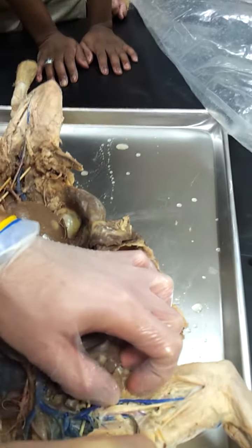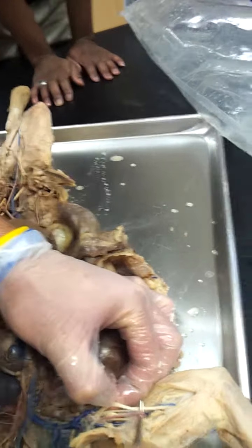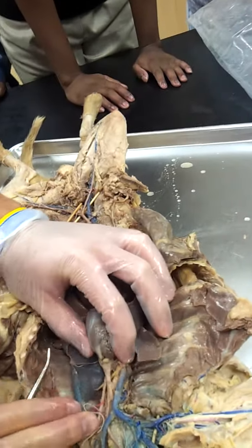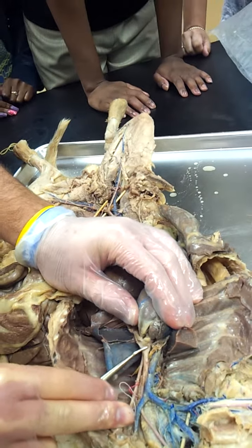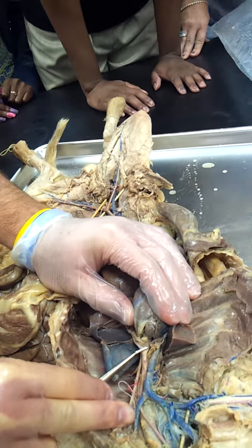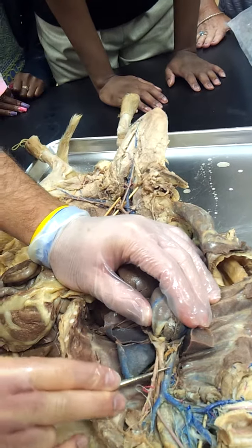Okay. We've got a lot of nerves here from the brachial plexus. But you can see that artery right here. If we look at the aorta, it's hard to see from your side, but there's a tiny part where everything originates from. That's actually going to be the aorta. You can see two portions, one here and one here. It's no longer the aorta at that point.